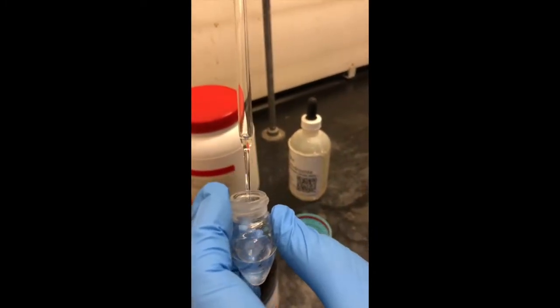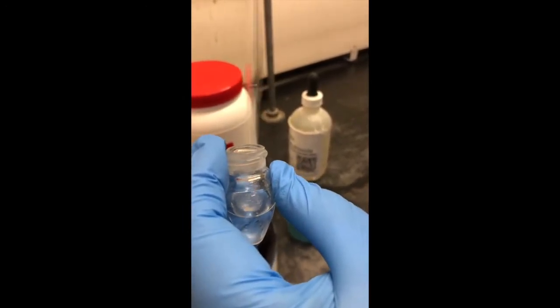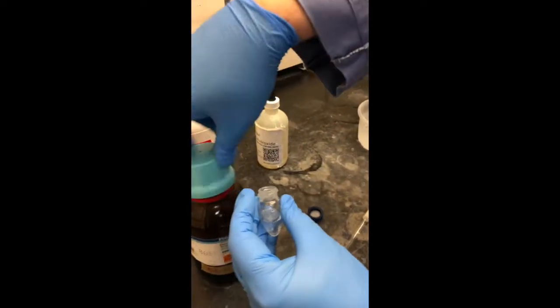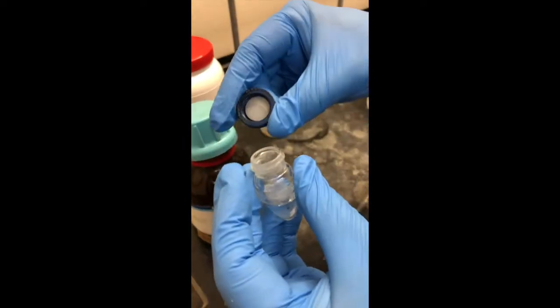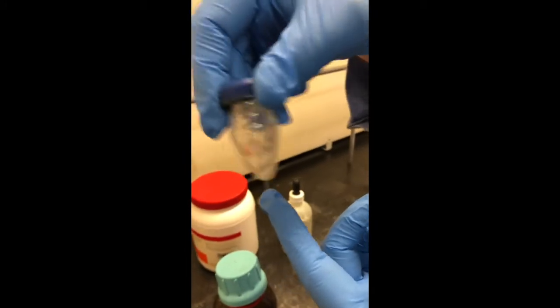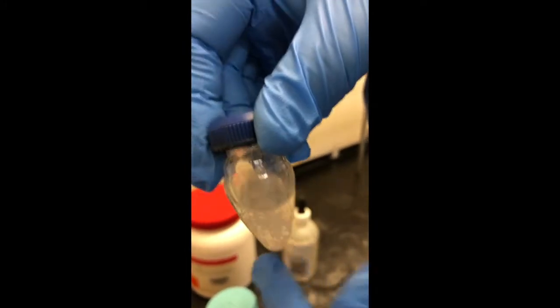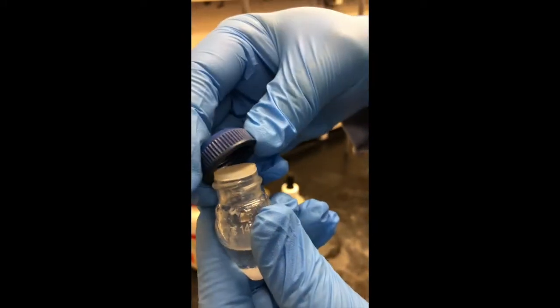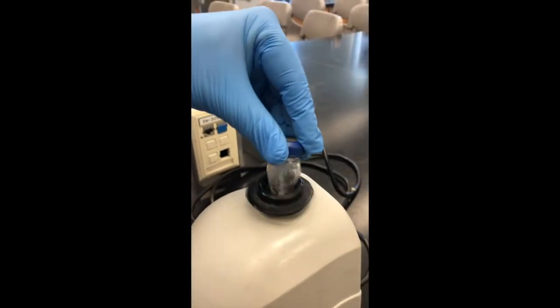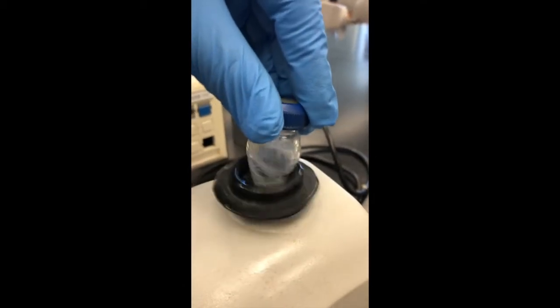We also need to be careful to do this in a hood with goggles and gloves, as the benzoyl chloride is a strong lacrimator, very harmful to your eyes and skin. Then we replace the cap Teflon side down and make sure that the cap does not leak. You can see the oily droplets that sink to the bottom from the benzoyl chloride that doesn't dissolve in our solution. Venting. Checking that the cap is nicely sealed one more time. Okay. You can then bring it over to the stirrer, pressing down, get it to stir a little bit. This begins the reaction.